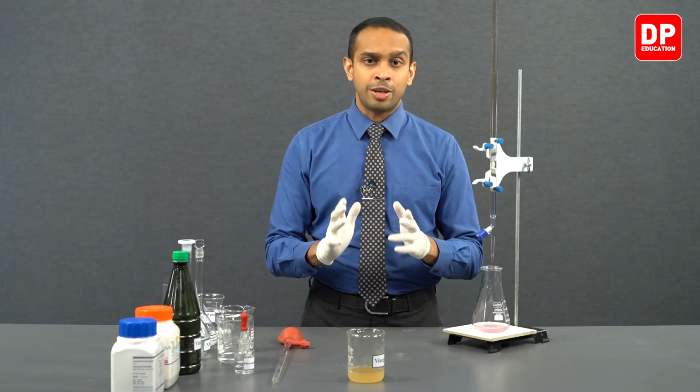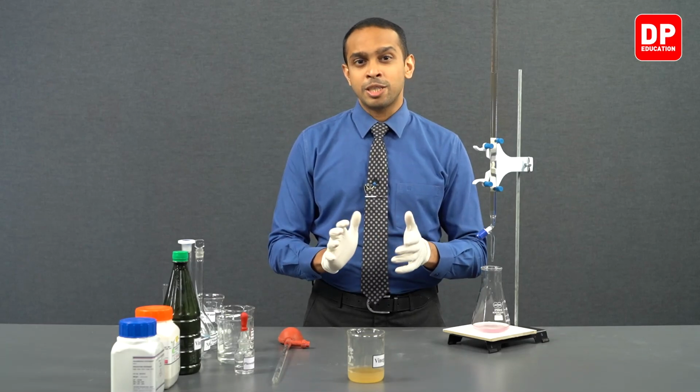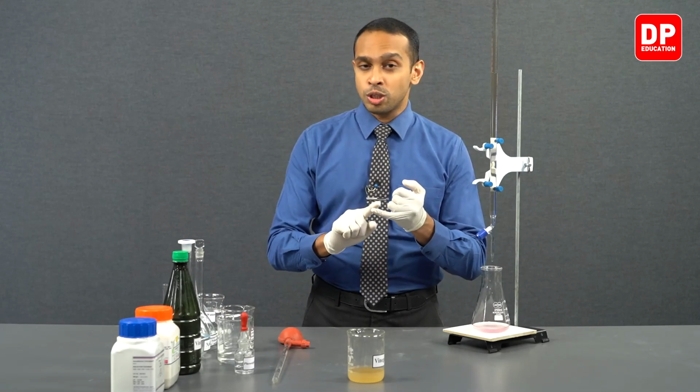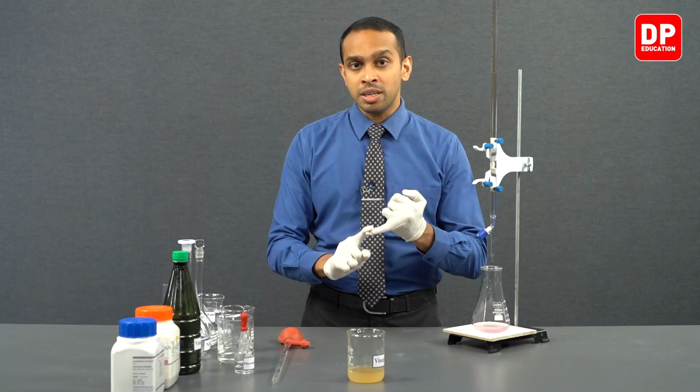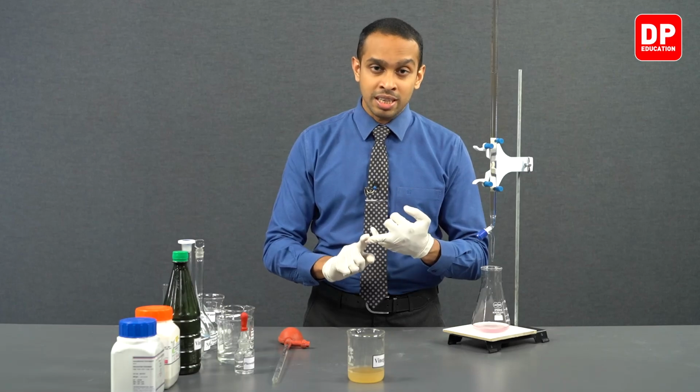So now we have titrated the acetic acid in a vinegar sample, and using the burette readings that we obtained here and the concentration of sodium hydroxide that we have calculated earlier, we can calculate the number of moles of acetic acid that was present in 5 cubic centimeters of vinegar. Based on these values, you can calculate the concentration of acetic acid in vinegar and also the percentage or mass percentage of acetic acid in vinegar.